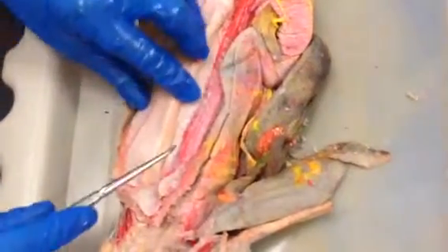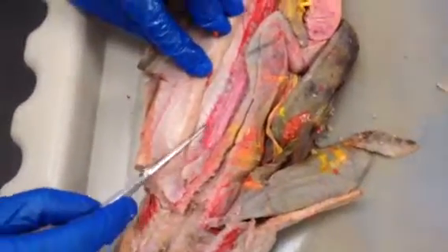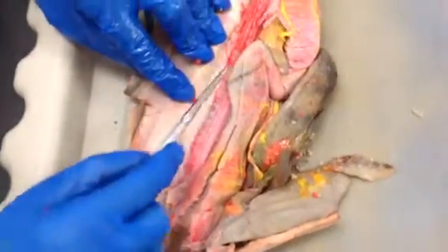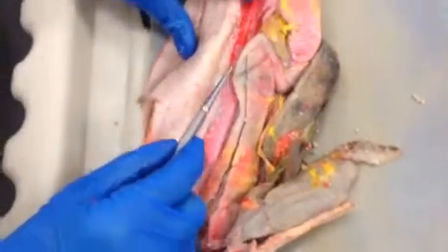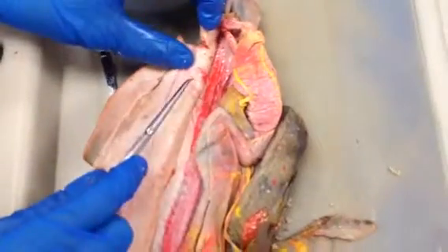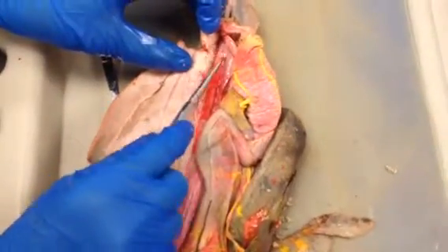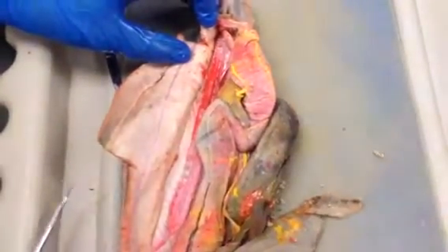Okay? The ductus deferens, with the sperm and seminal fluid, actually runs on top of the kidney, but you can't see it. Then the bottom two-thirds here is just kidney, with of course the ductus deferens running down here. And in your book it says there's a sperm sac and a seminal vesicle here, but you can't see any of that because it's too immature.